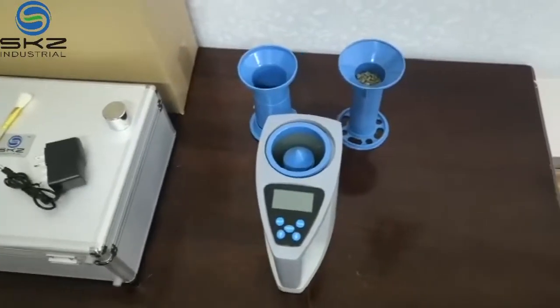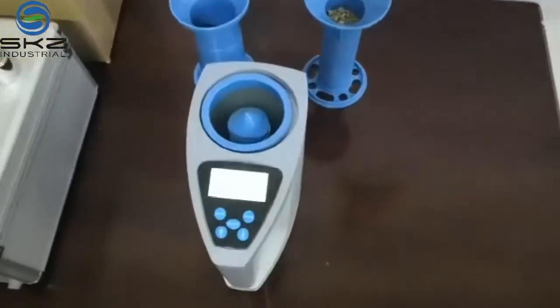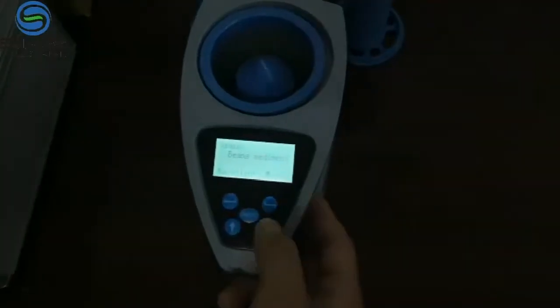First, sometimes it may need calibration. Now we power on and I'll show how to calibrate.